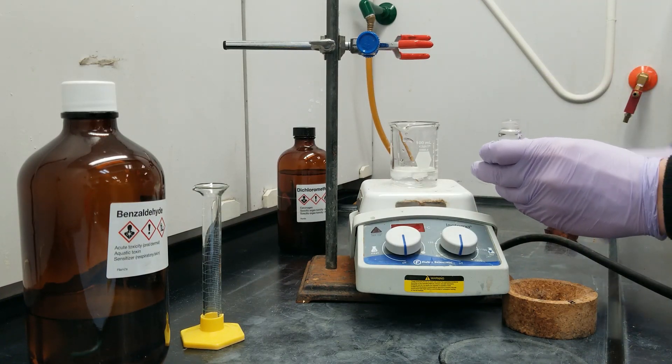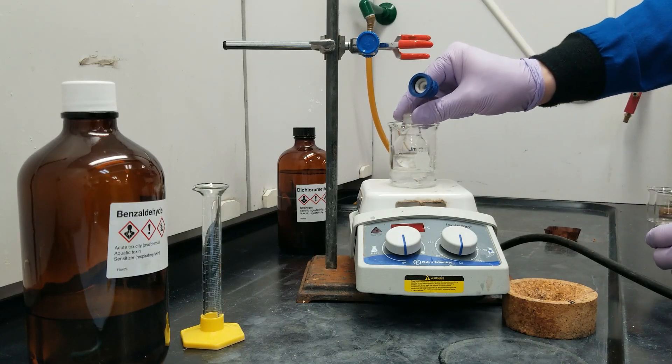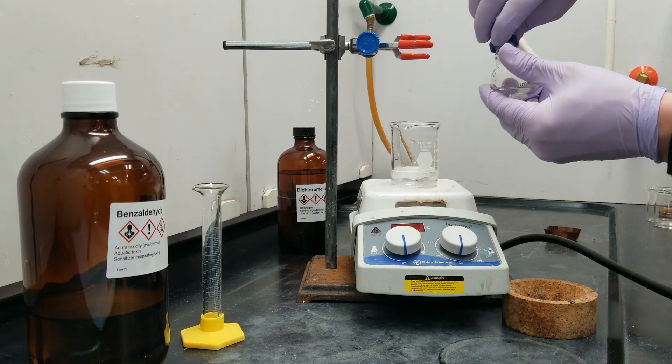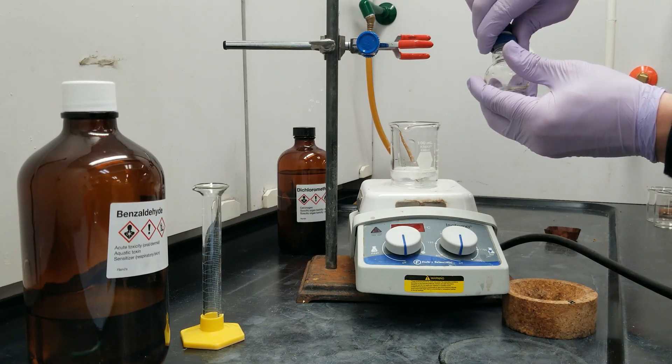It doesn't have this in the procedure, but I'd like to be able to clamp this in my ice bath as it stirs. So I'm just going to add a little bit of glassware so that I've got something to use as a handle.